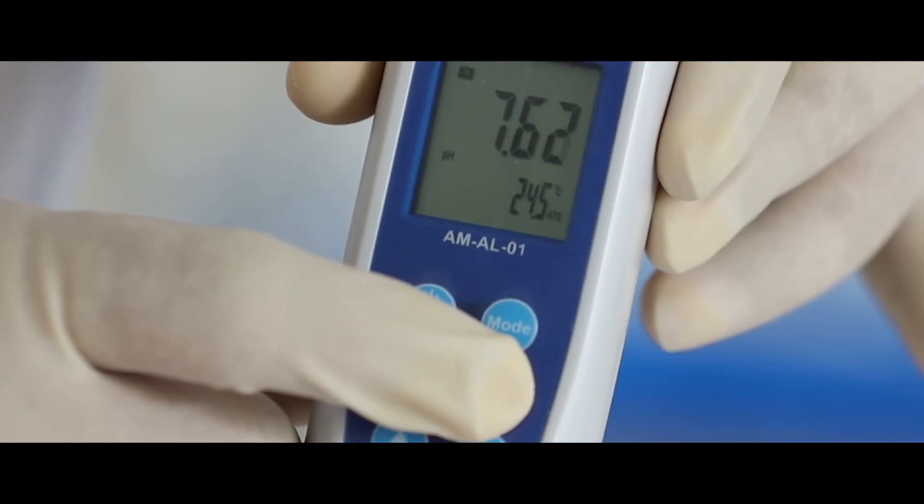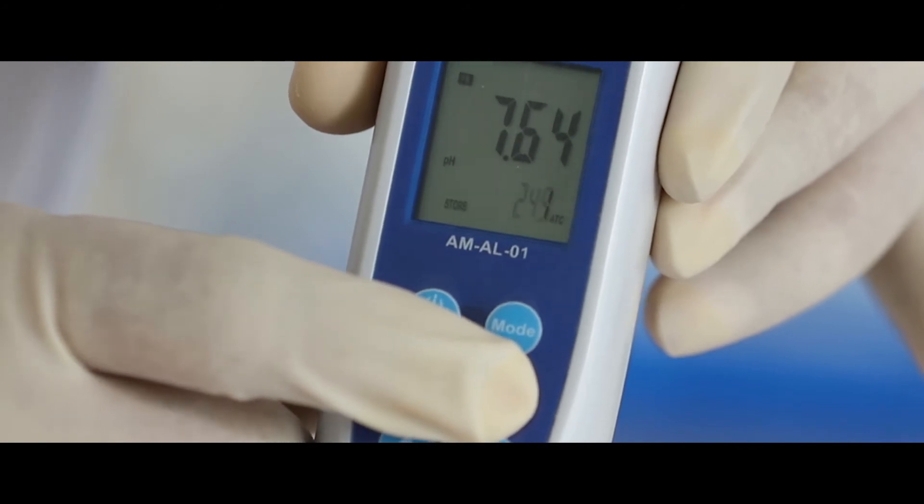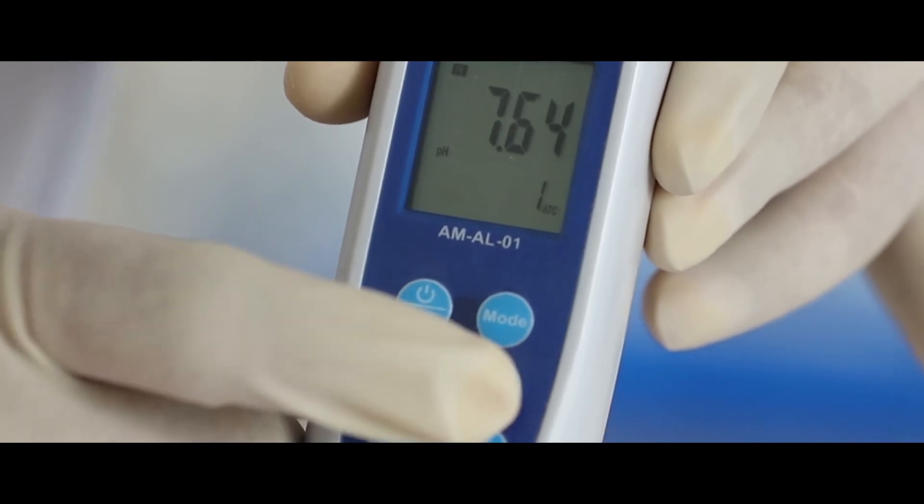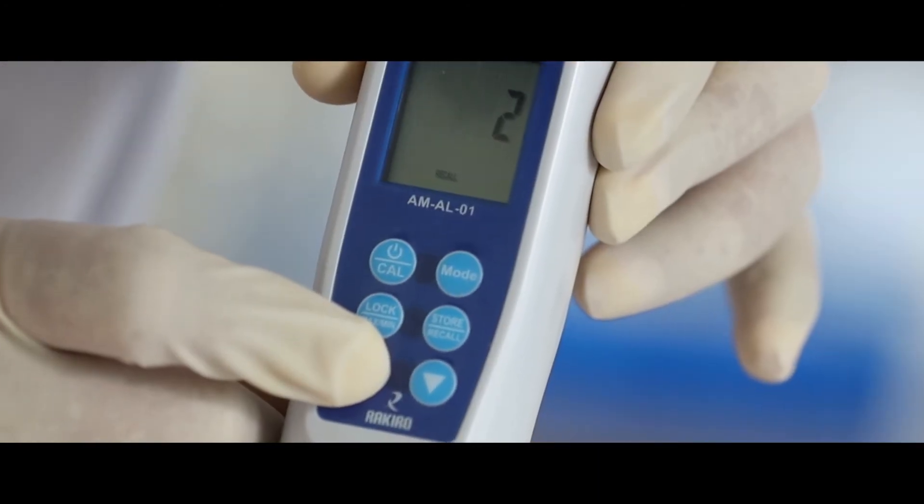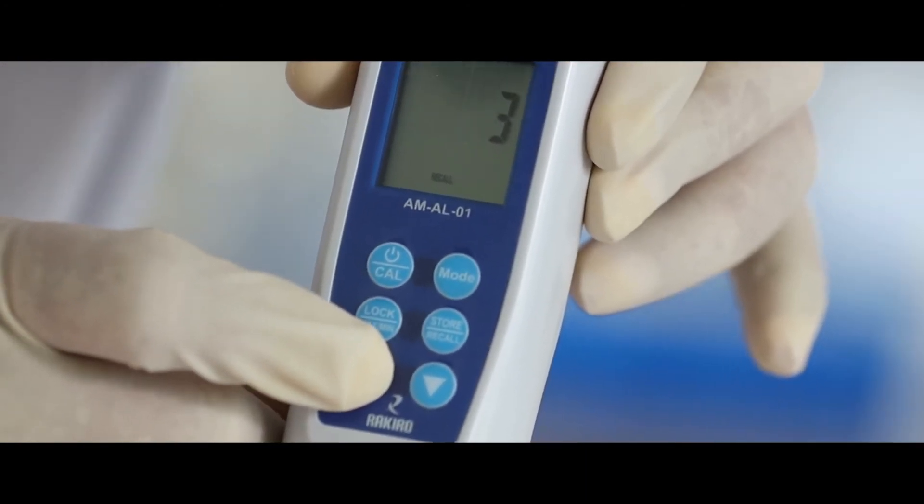To store the data, press the store button. To recall the stored data, press and hold the store button. Use the up and down arrow keys to navigate through stored data.